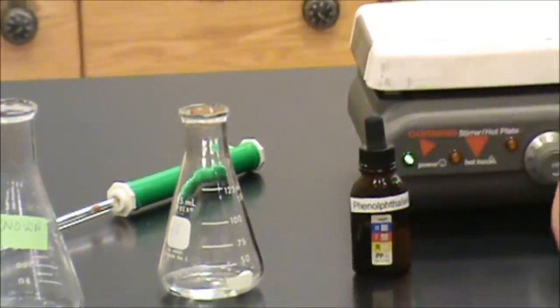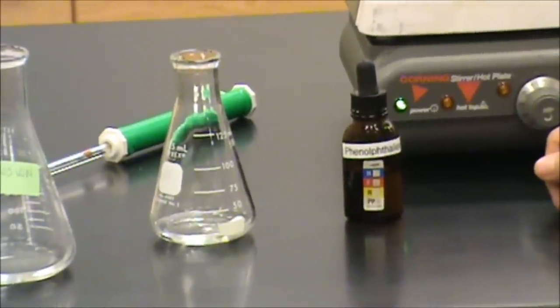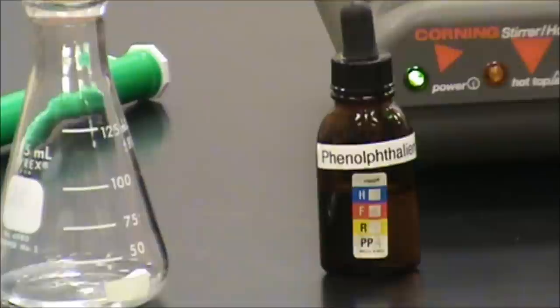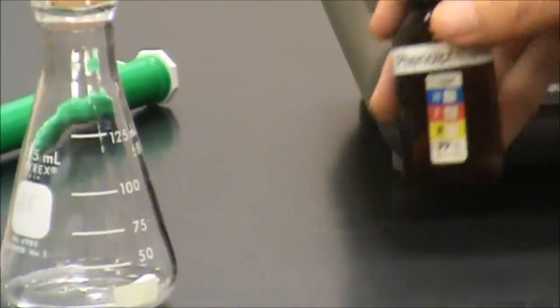Finally, you must be very sure to add a few drops of your pH indicator. If you do not add this indicator, you will not be able to see when the reaction is complete and it will wreck your experiment.